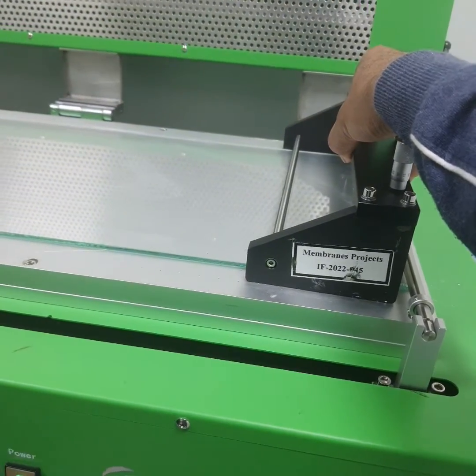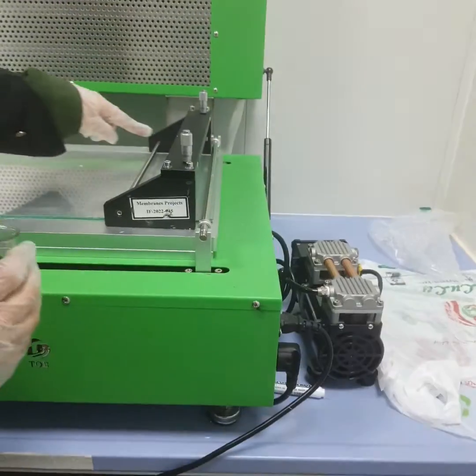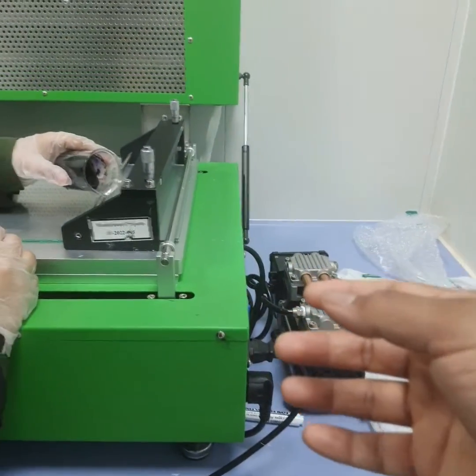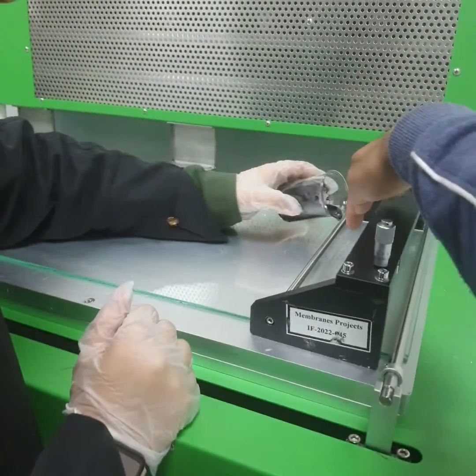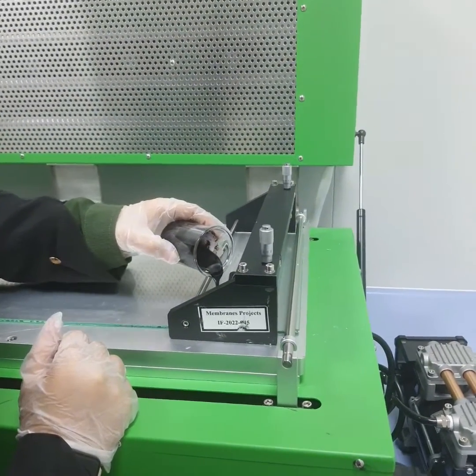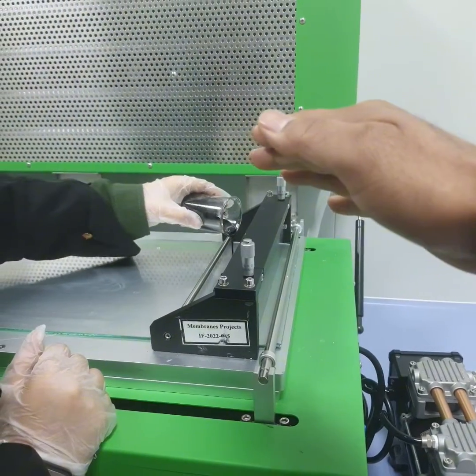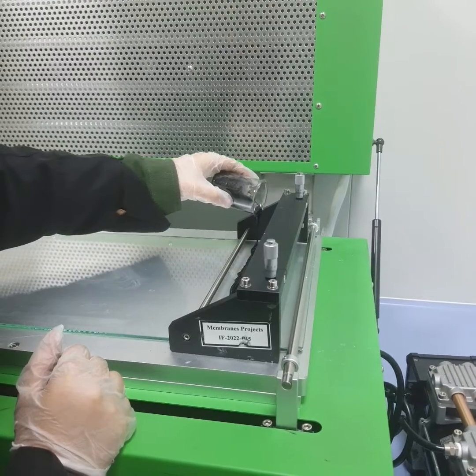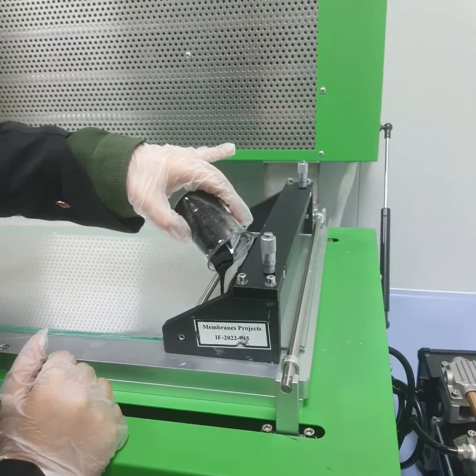Pour it in the middle, not at the corners. Start from the middle, and then spread evenly. Try to stay a little away from the extreme right and extreme left. If you can prepare two, it's better. If it is okay to spread all, it's okay. Otherwise, you can leave some amount for preparing another membrane.